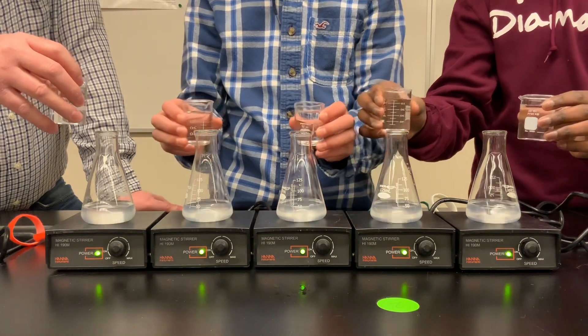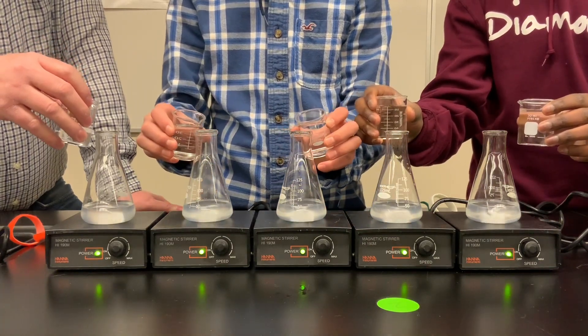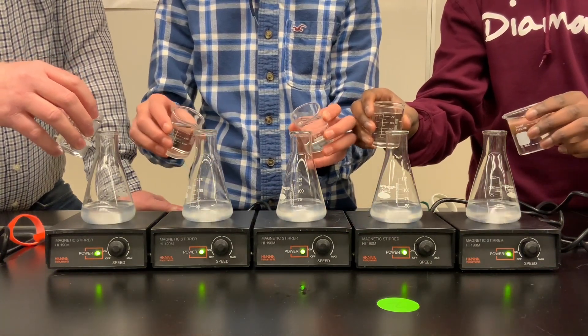Three, two, one, go — we'll add the potassium iodate the same way we did before.